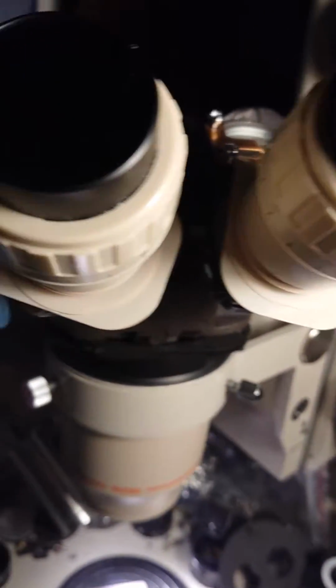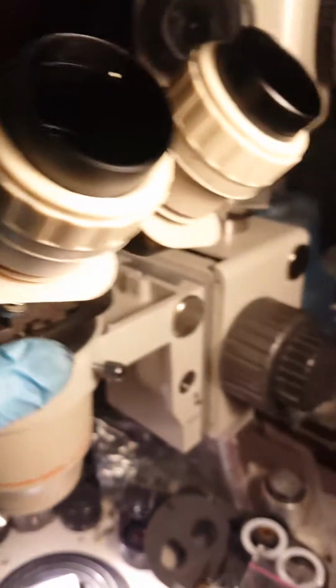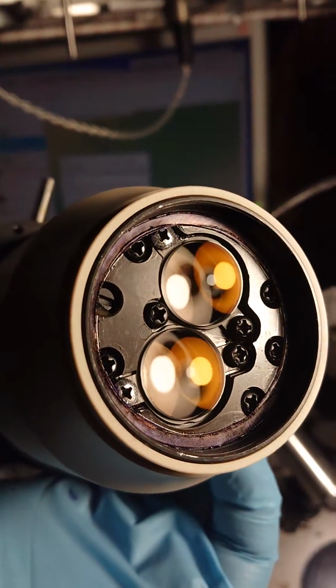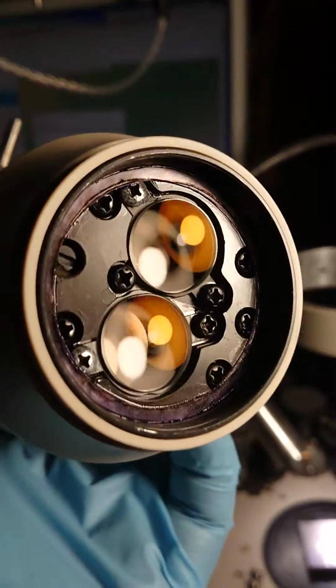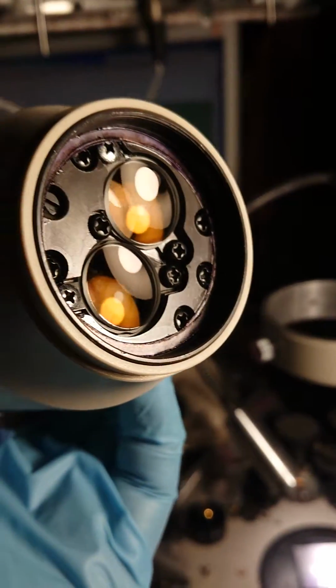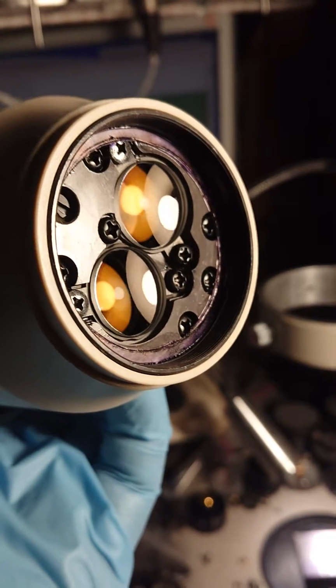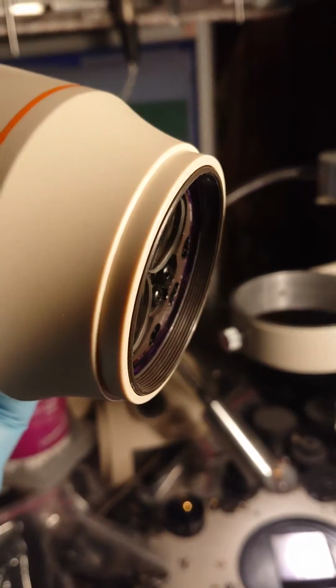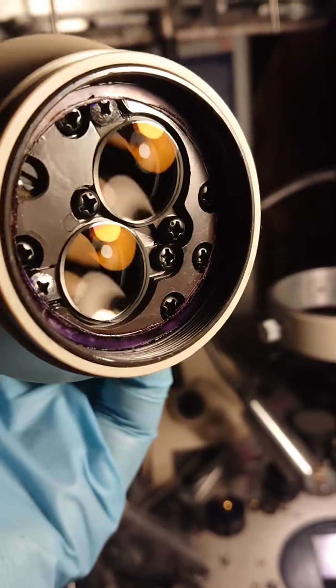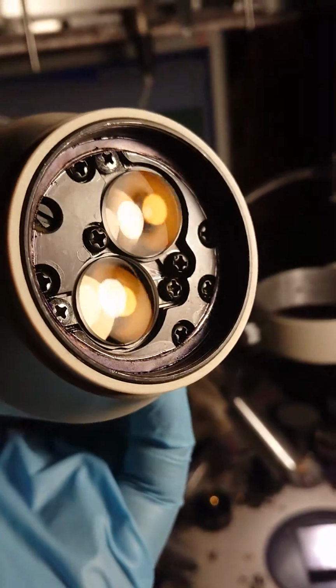I can even show you, maybe a bit from the front, the part ready to get a protective glass on it. I made a layer of paper, and after finishing all adjustments, I need to glue a protective glass here.